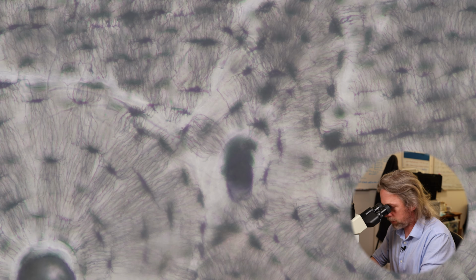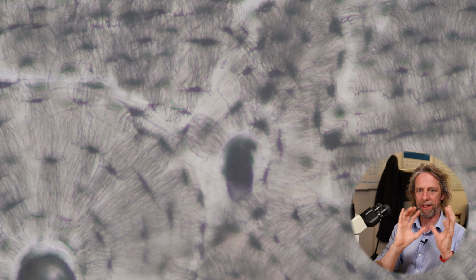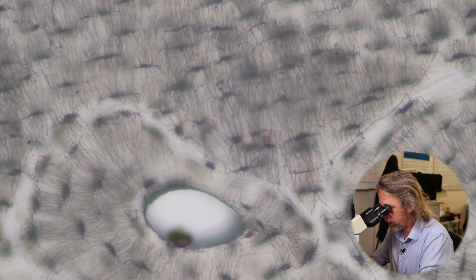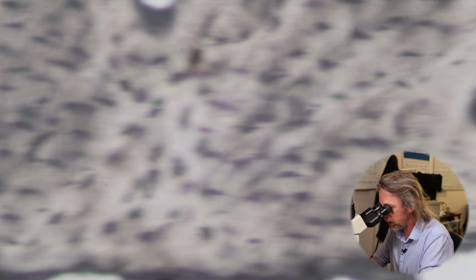Now I think, yeah, so like I said, there are some layers around the outermost edges of the bone, which are kind of not osteons, they're other layers. But we're not going to see that here because this is just a cut chunk of bone. We're not seeing the true edge, are we?